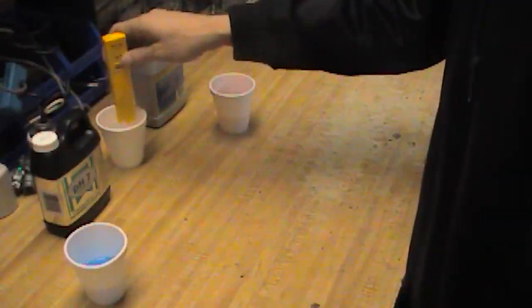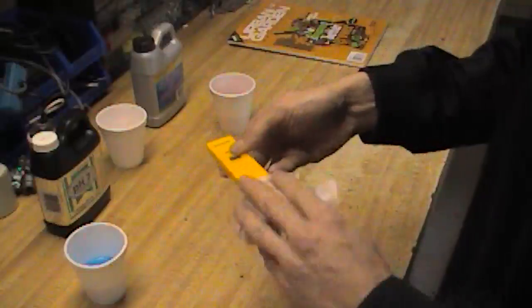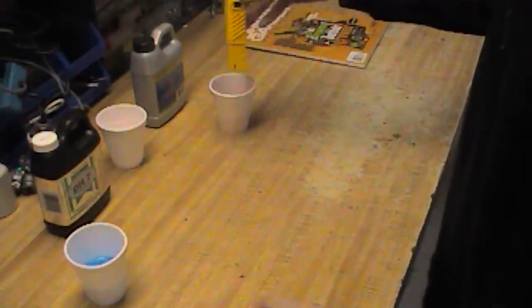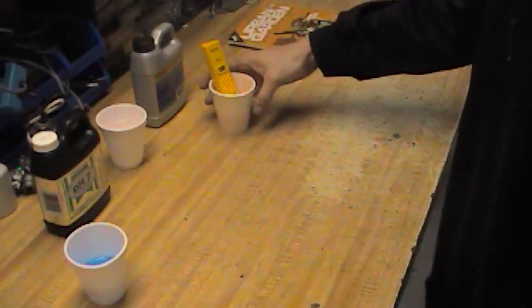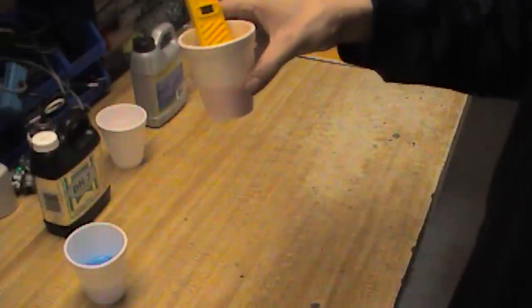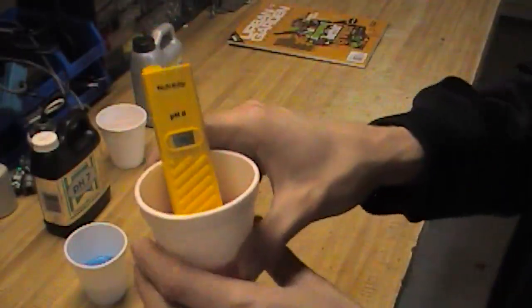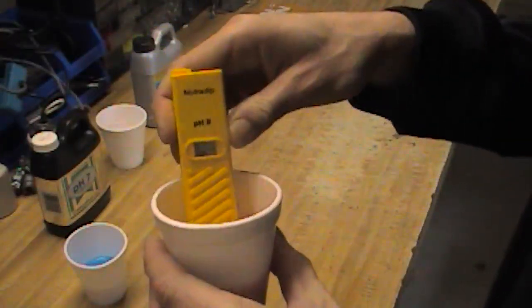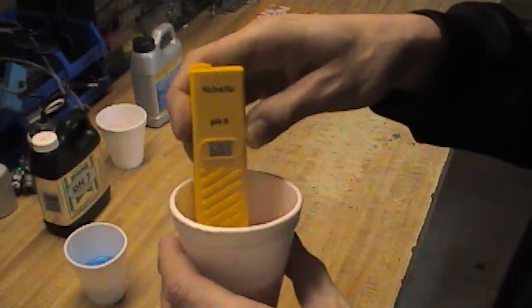So let's give it a dip in plain water here and into the pH buffer number 4. Instantly it switched to 4.2, 4.1 with a bit of a stir.